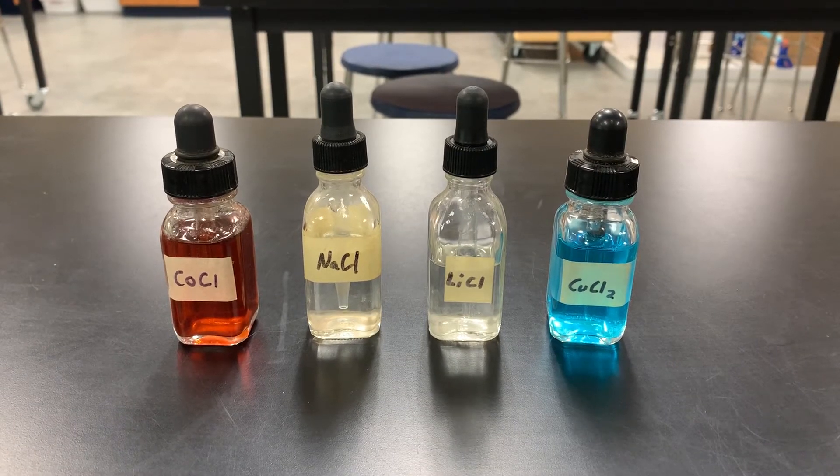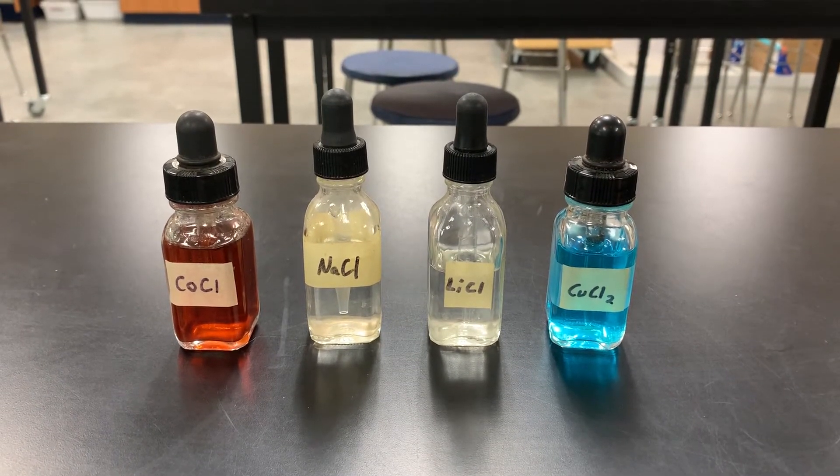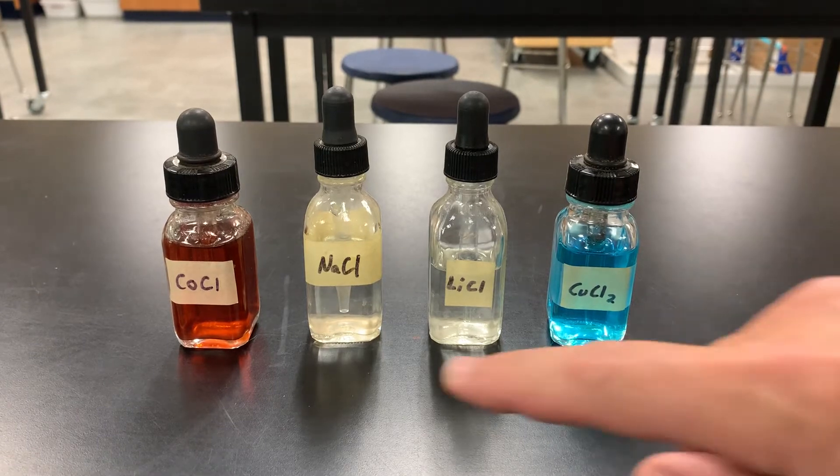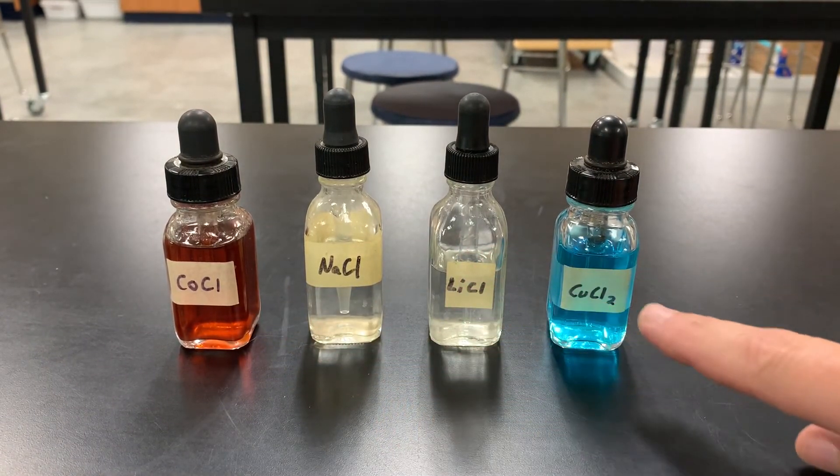In this experiment, I'm going to show you the color that four different chemicals make. All of them are chlorides.